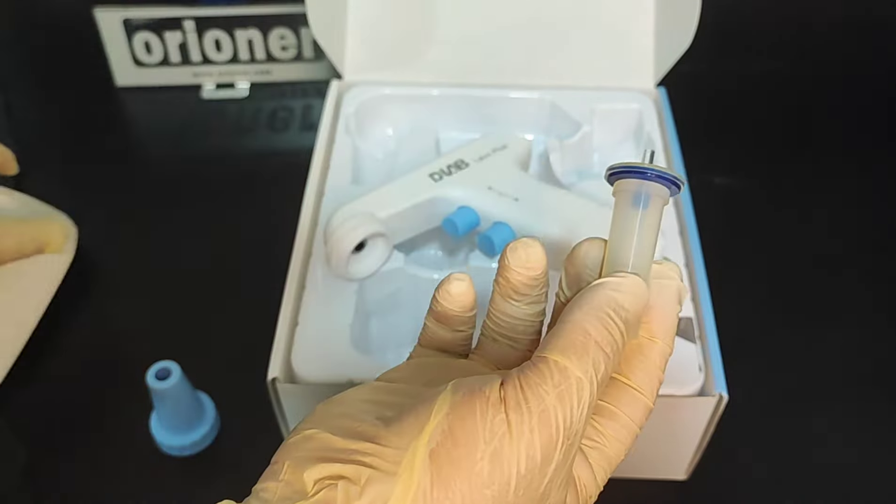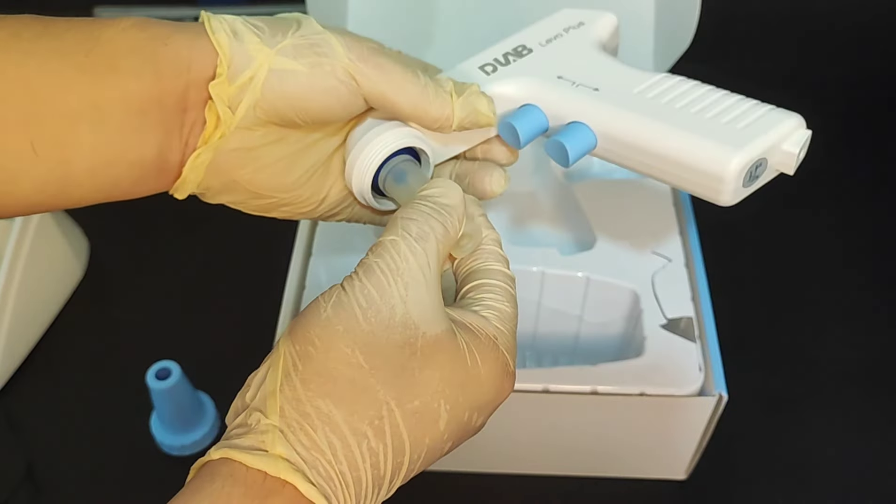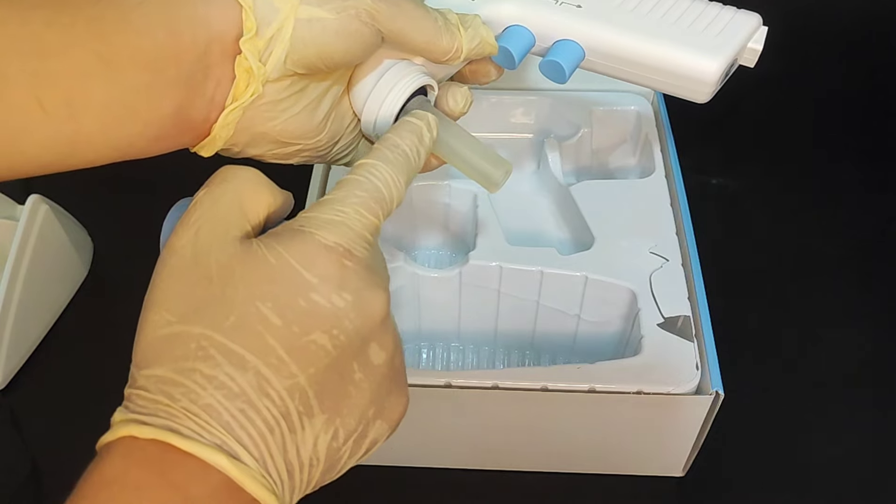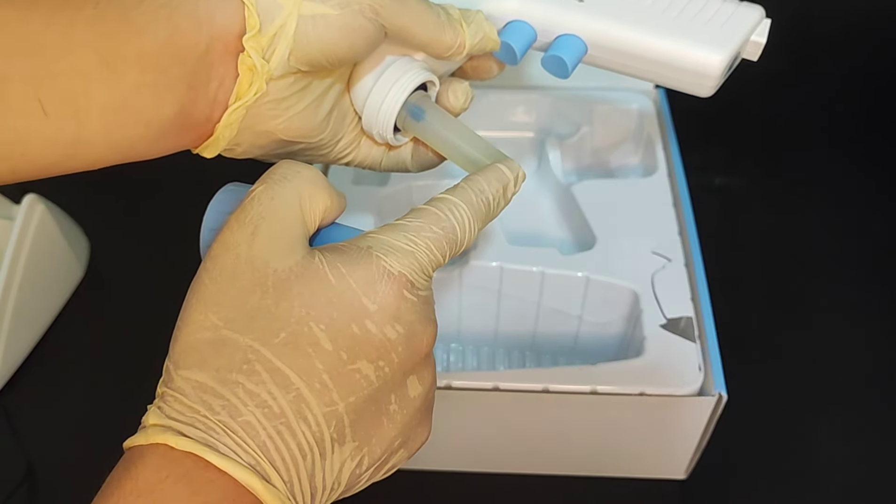And we connect it here. And we put it back. Close it. Importantly, this part can be sterilized. If we use the sterilized filter and sterilized silicone adapter.